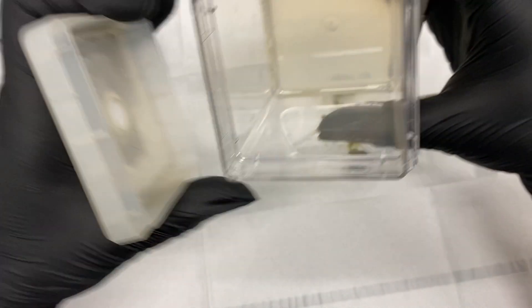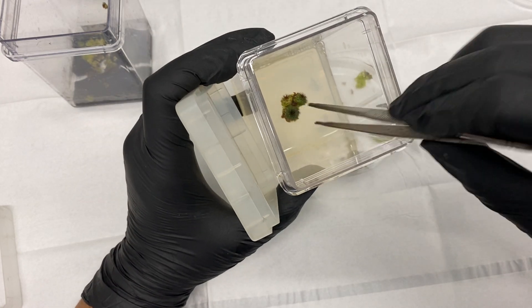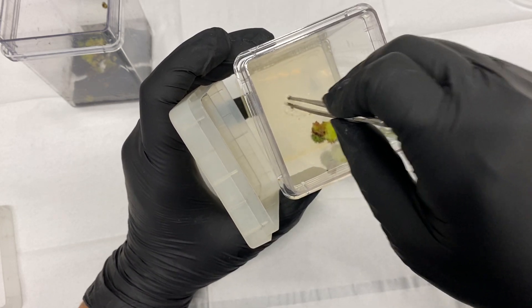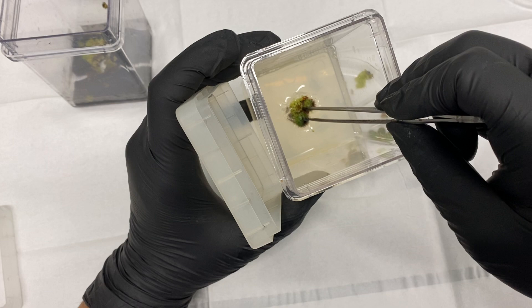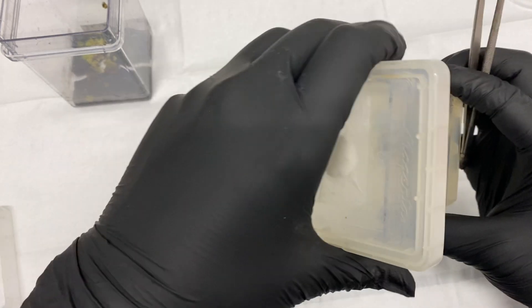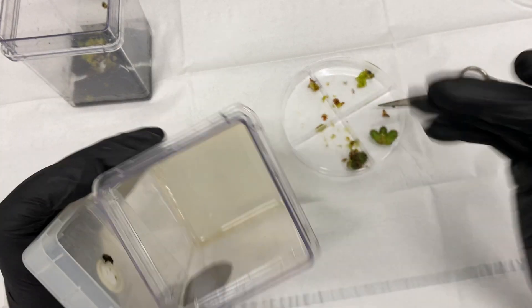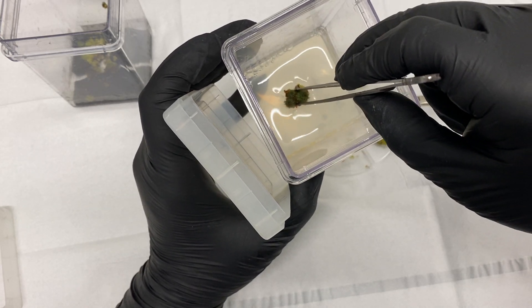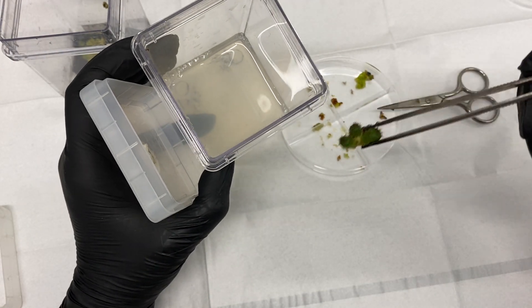I have my box and I'm going to try not to damage it too much. Remember when you're sticking something into tissue culture media, you want it half in the media and half out of the media — the more contact the better, but it also needs airflow. There's one from that cluster, now number two of that cluster, and three of that cluster. Beautiful.